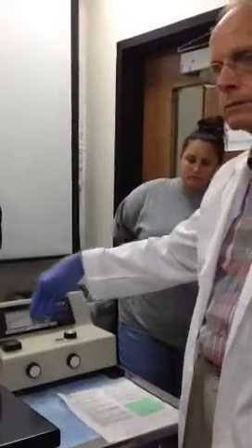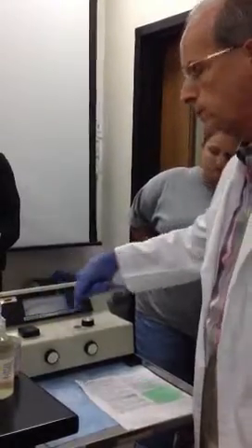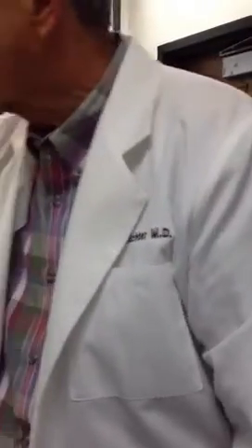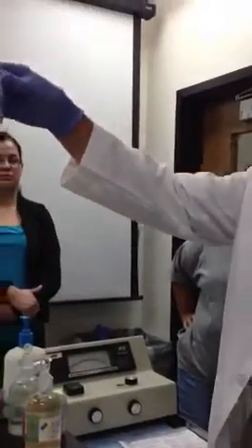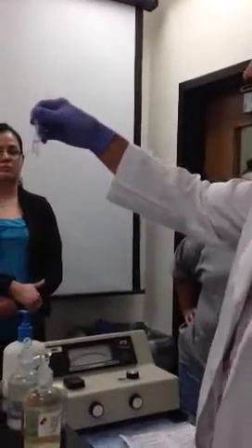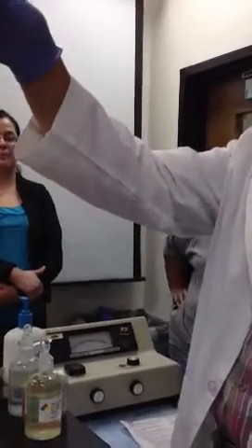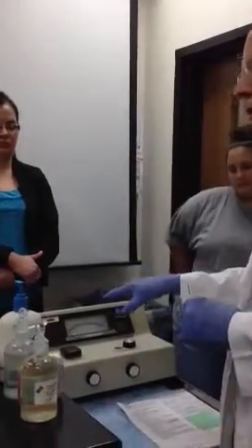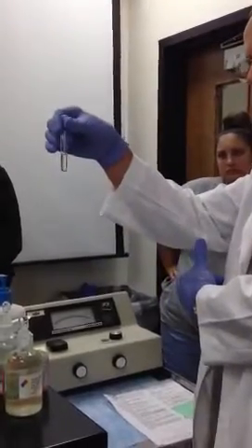There is a beam of light crossing this channel right here. It's running this way. So if we took, say, a tube of liquid like this. Now this one happens to be quite clear, doesn't it? Would you say that a beam of light would pass readily through this because it's clear? Right? So this machine indicates how well a beam of light transmits through solutions.